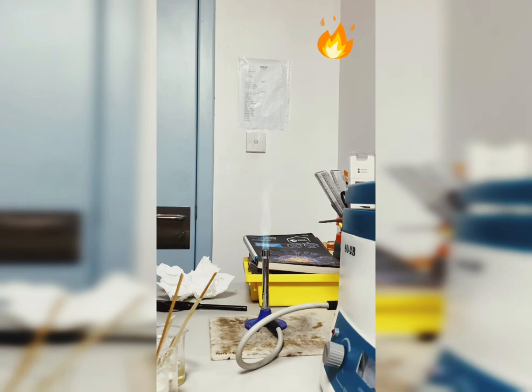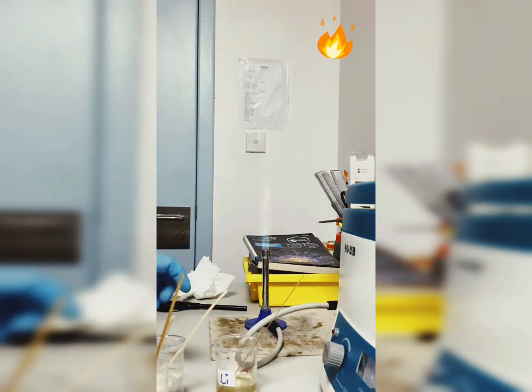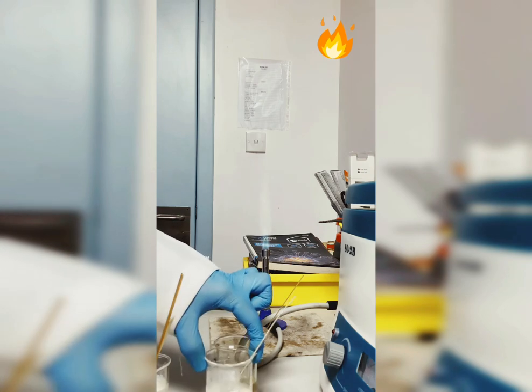In today's tutorial we will be doing flame tests. As you know, the flame test is a very common test found in different curricula, and it uses the same chemicals every time. What we need to know is which chemicals we are using and which ones are good for identifying the colors using the flame test.